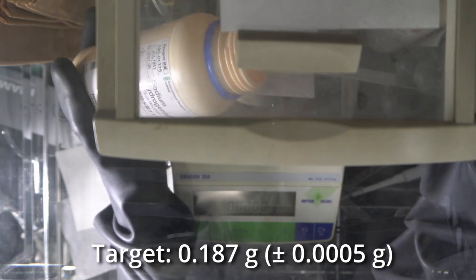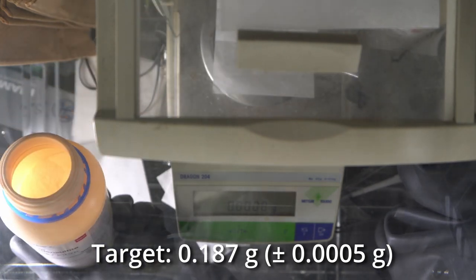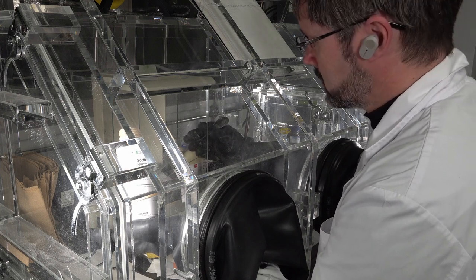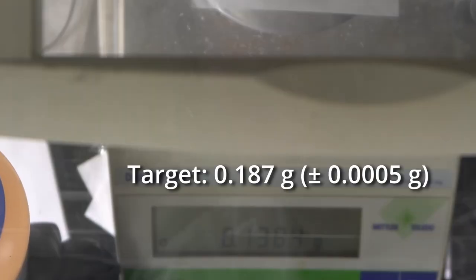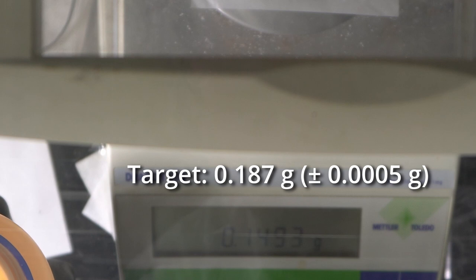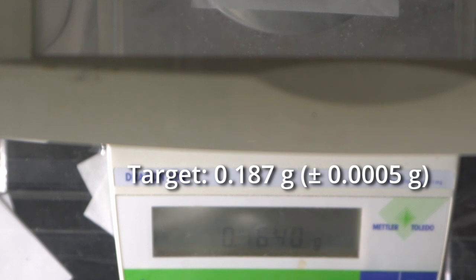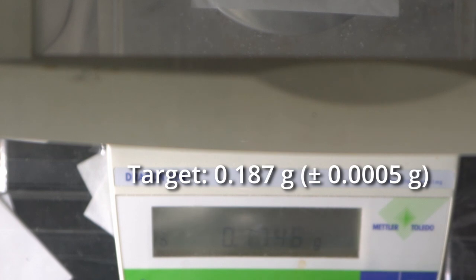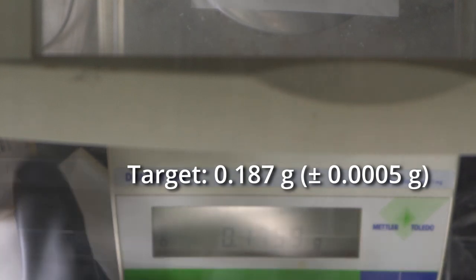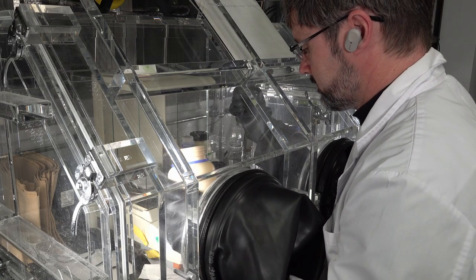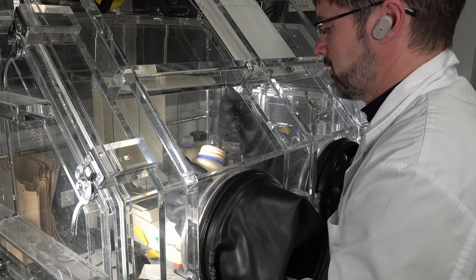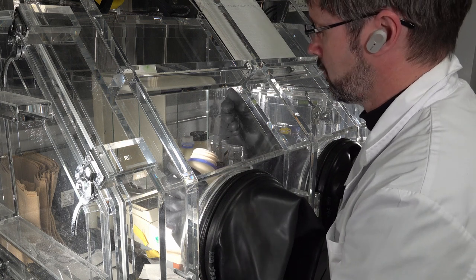So I'm gonna start with the nice big spatula and get us into the area. You can see the problem with weighing out small amounts of powder - you have to be so careful. It's so easy to go just one nudge too much. Oh, that's exactly what I was talking about! It all went off in one go.